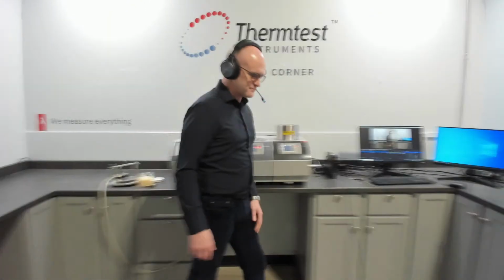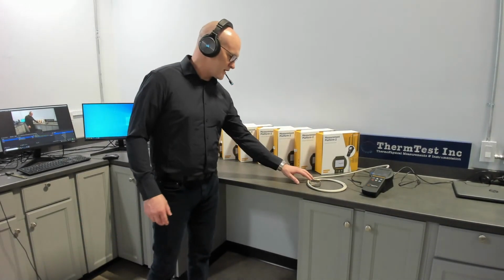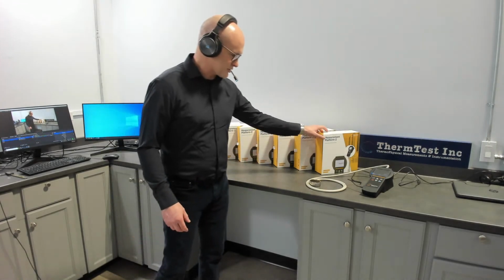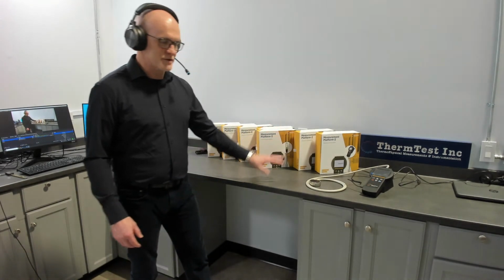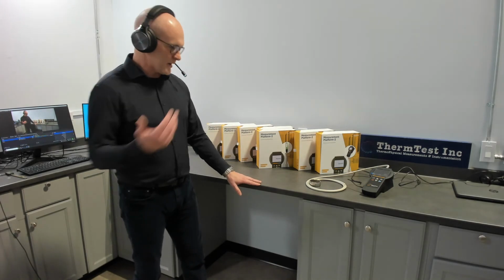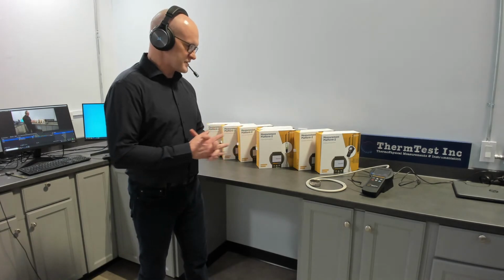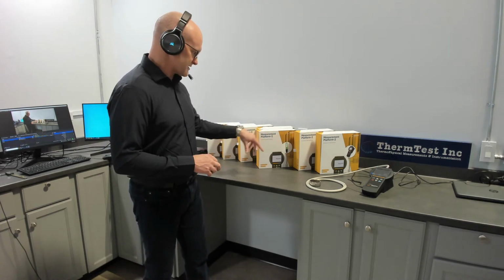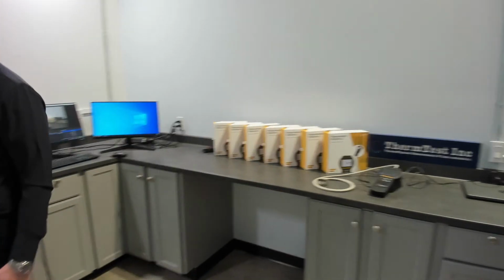To the left of us is our MP2. This is our portable or economic unit measuring thermal conductivity across transient plane source and transient hot wire, so using primary methods, making absolute measurements that follow the theory of these methods, just smaller ranges, but absolutely designed to measure accurate values over the range of the sensors and the application they're designed for. So that's our MP2.